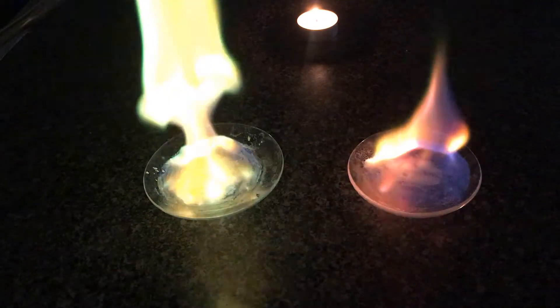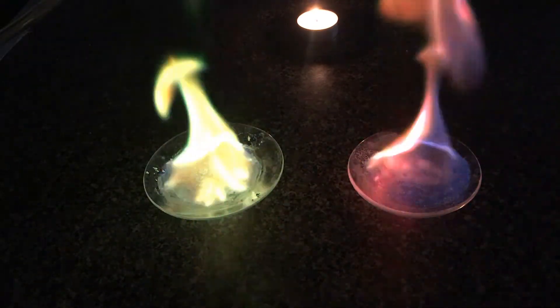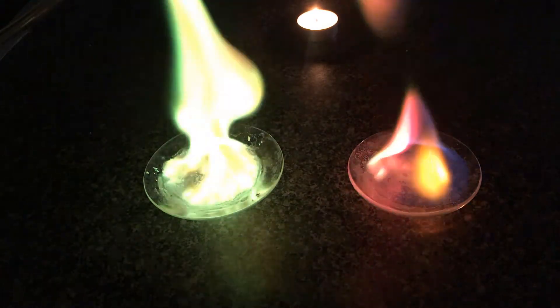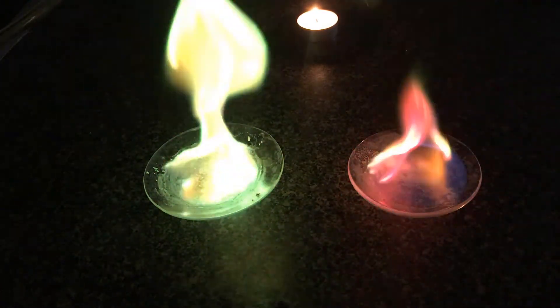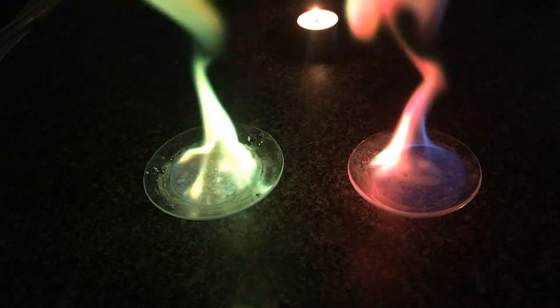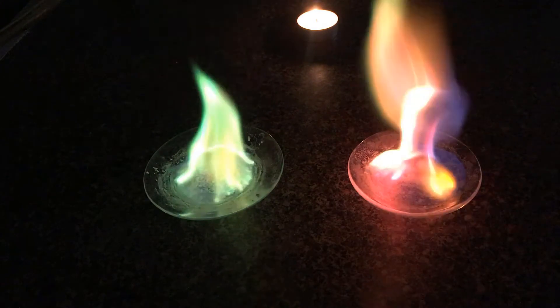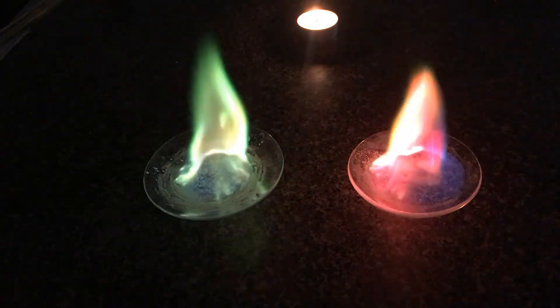At first, what you're seeing — the hints of blue — is actually just the methanol itself catching fire. And some of those ionic compounds afterwards also start getting atomized and ionized here. Copper ions give off a really bright green color, and we have the strontium ions similarly emitting a nice reddish tone.